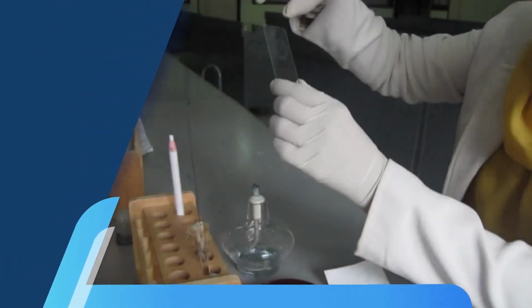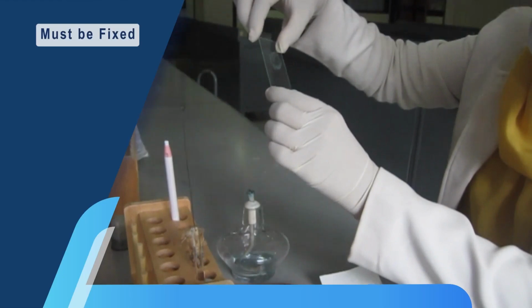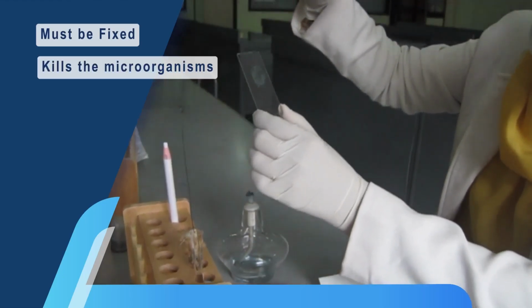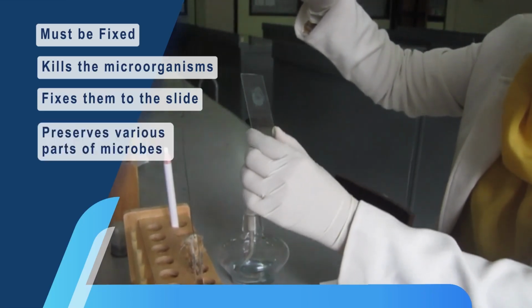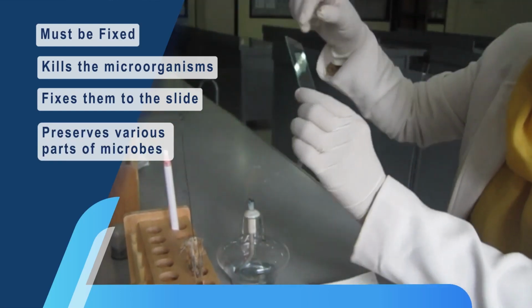Before the microorganisms can be stained, however, they must be fixed, or attached, to the microscope slide. Fixing simultaneously kills the microorganisms and fixes them to the slide. It also preserves various parts of microbes in their natural state with only minimal distortion.